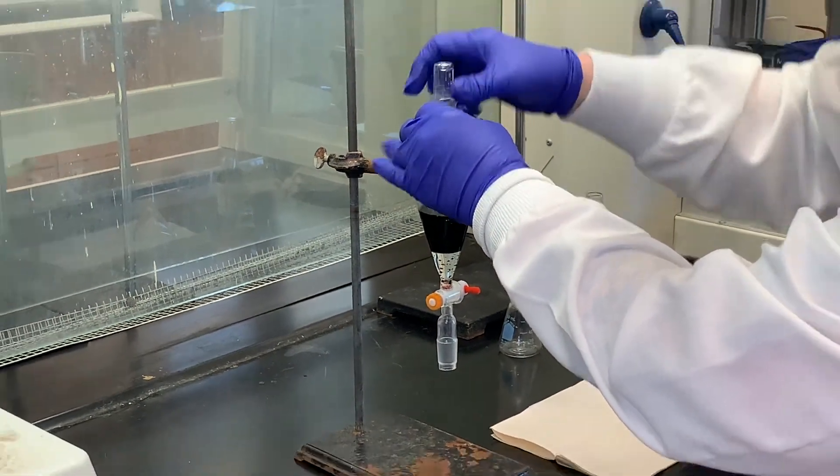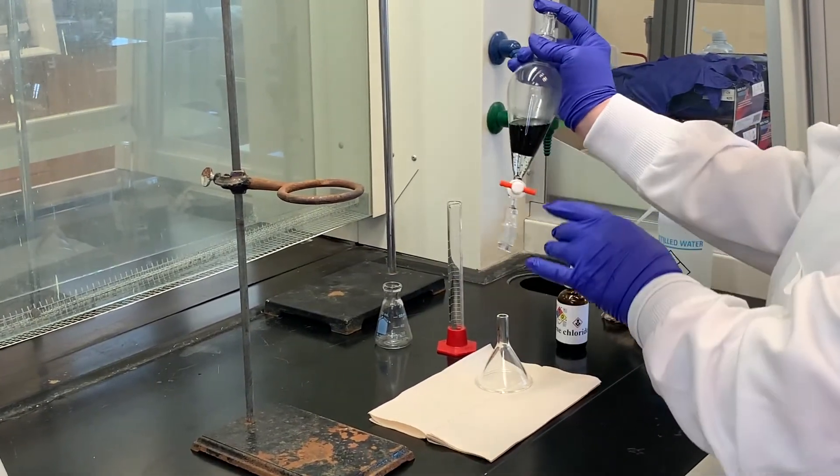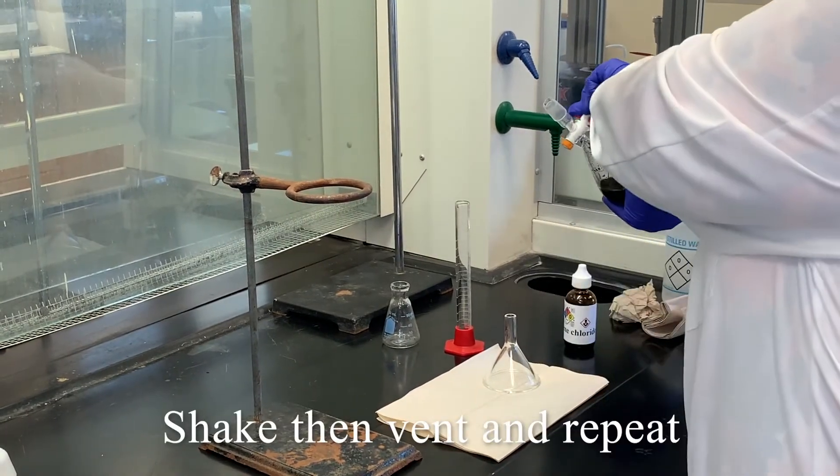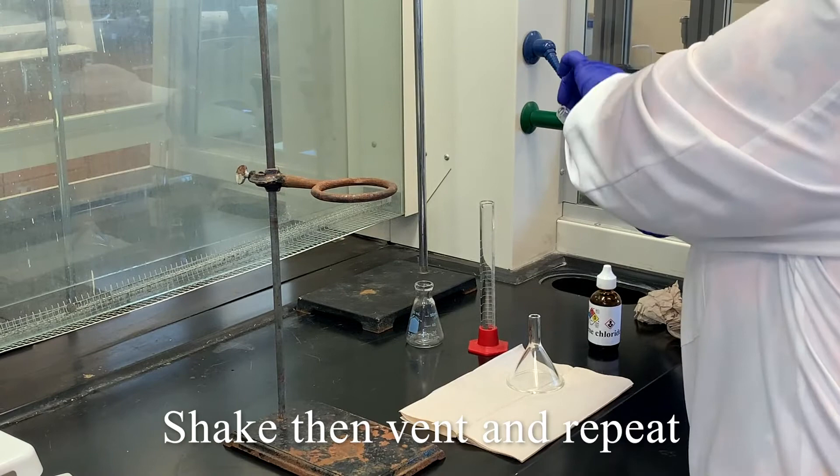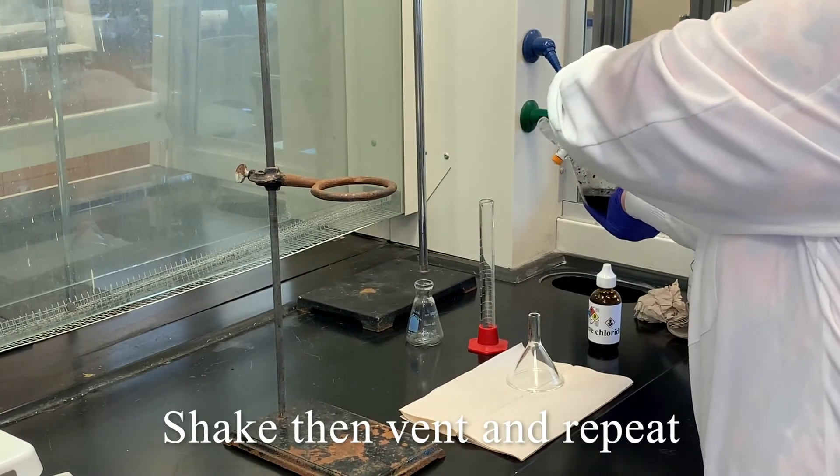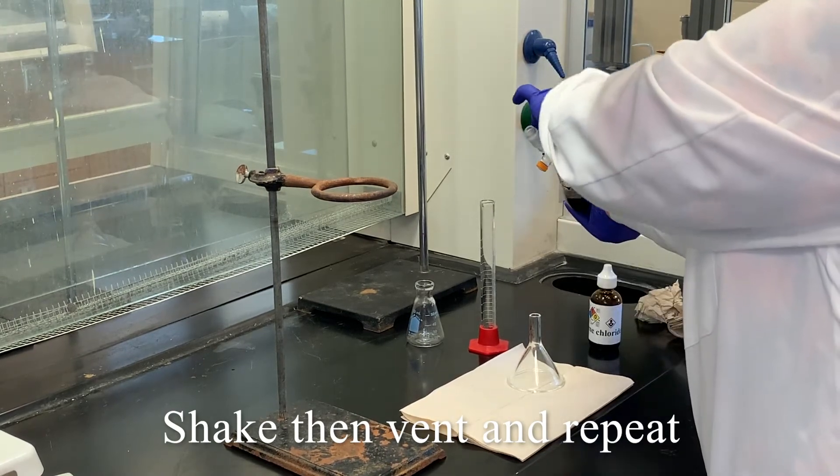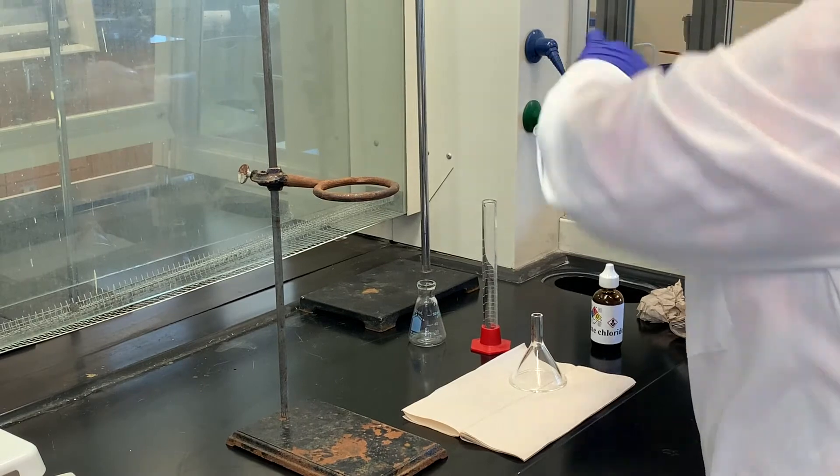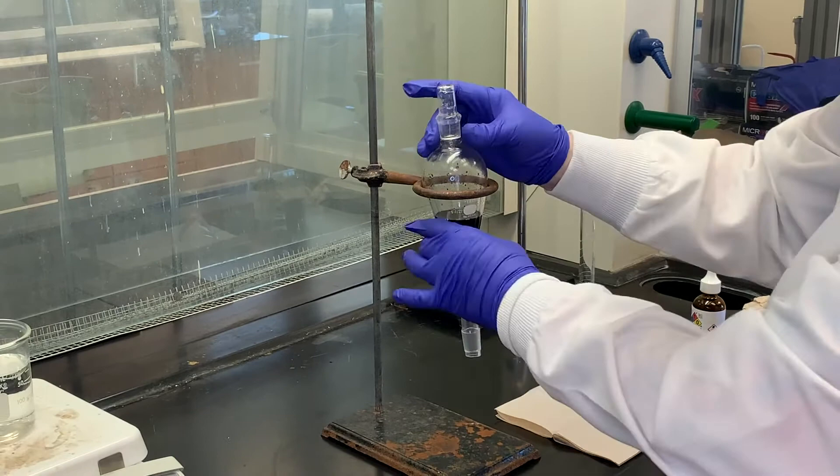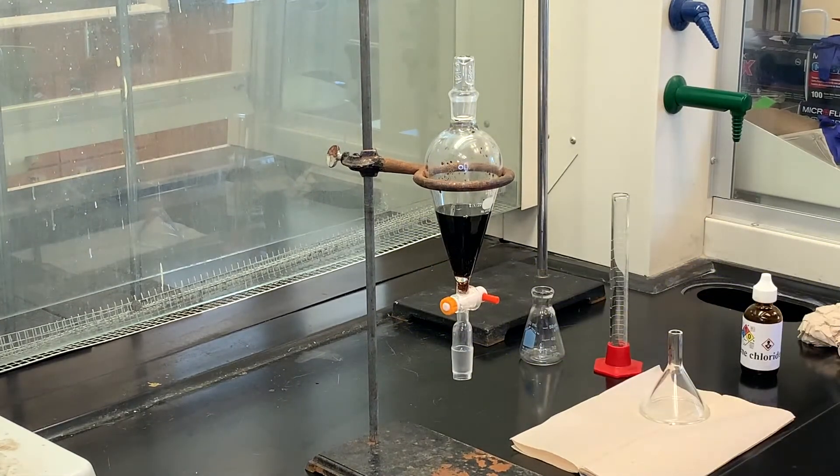You want to shake and vent. Make sure your finger is on top of the stopper. Turn it, shake a little bit, and vent. Shake a little bit, and vent. Then we're going to let that separate again.